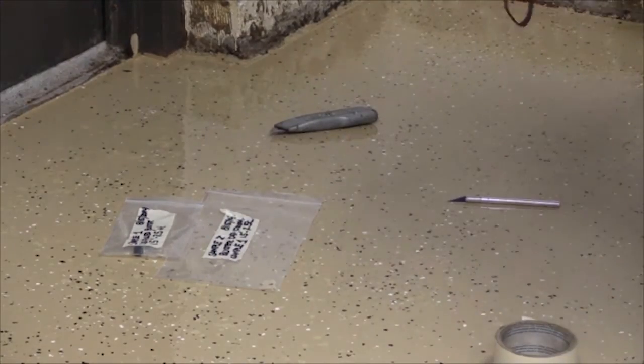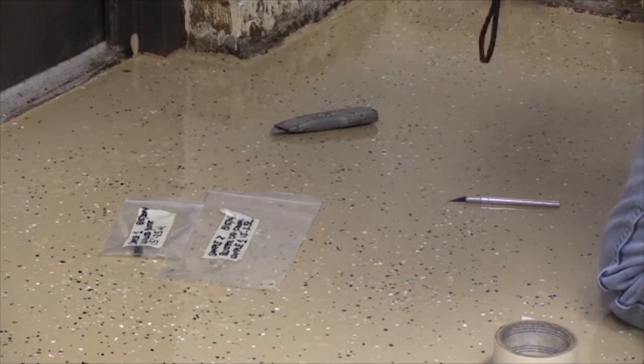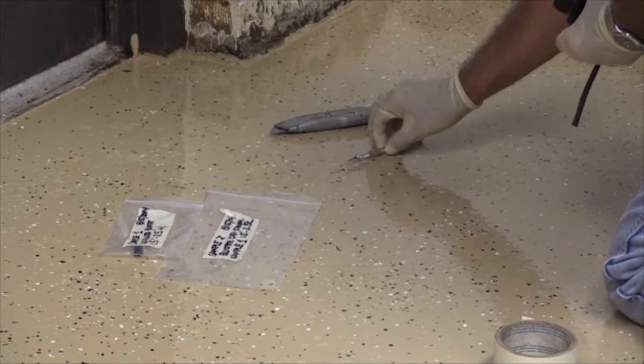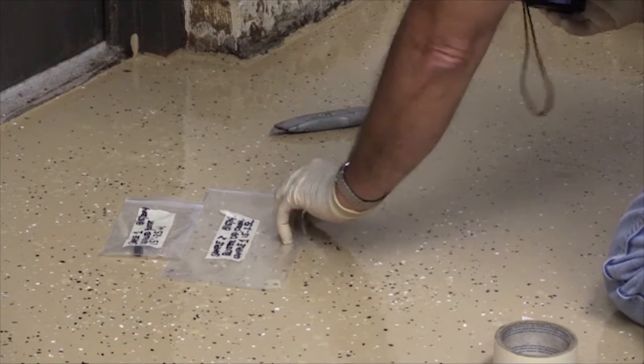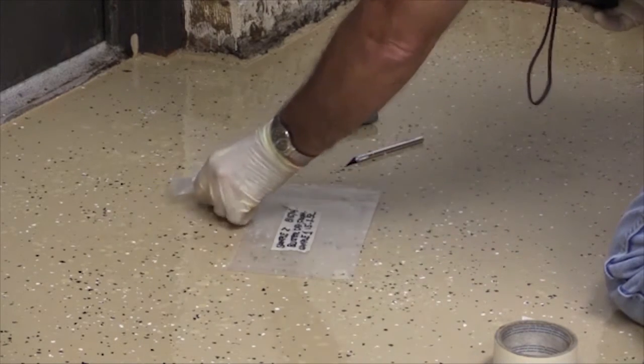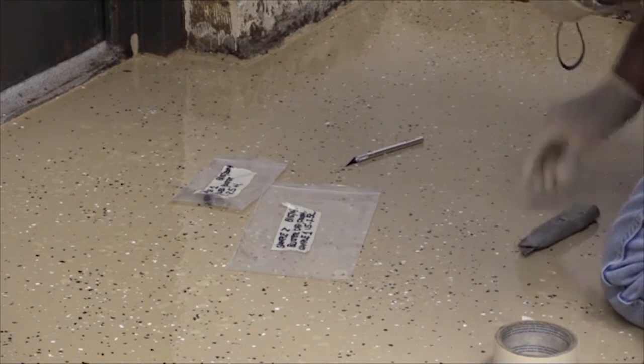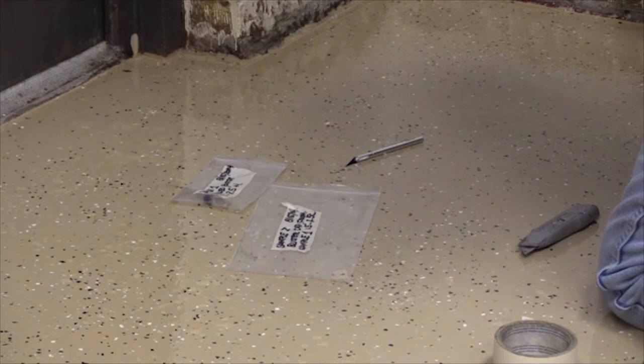The next thing I'll do is I'll put something there to designate where my blister was, and I'll put my samples in the picture, and I'll take a picture of all that together for documentation purposes.